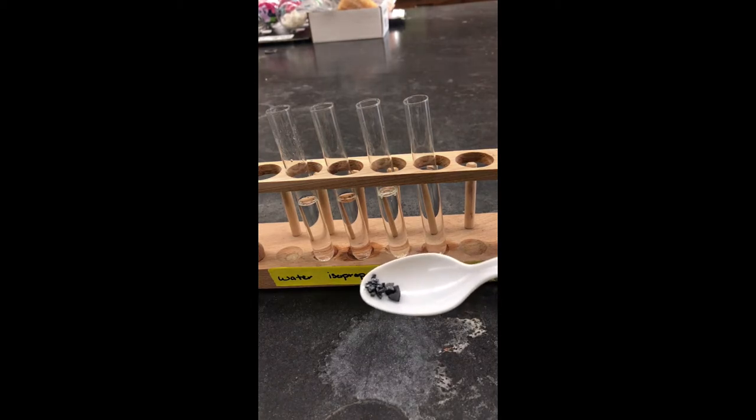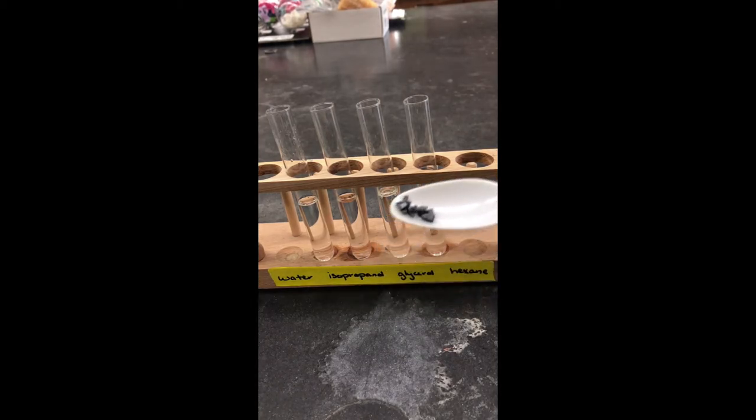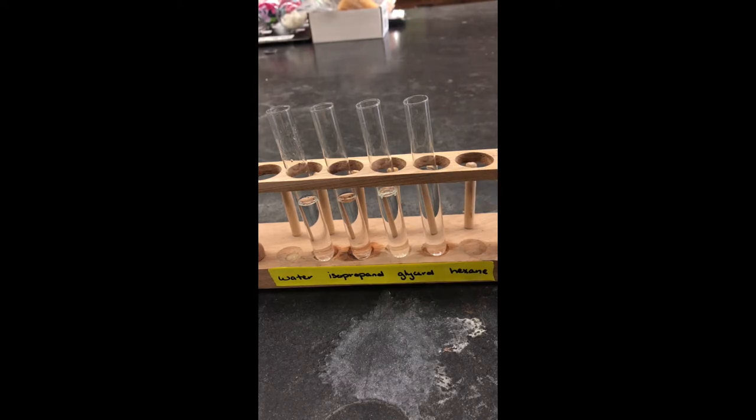This is solid iodine. I'm going to put a small amount into the water, the isopropanol, the glycerol, and the hexane.